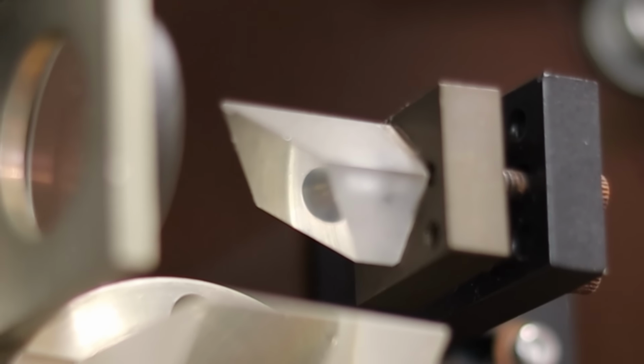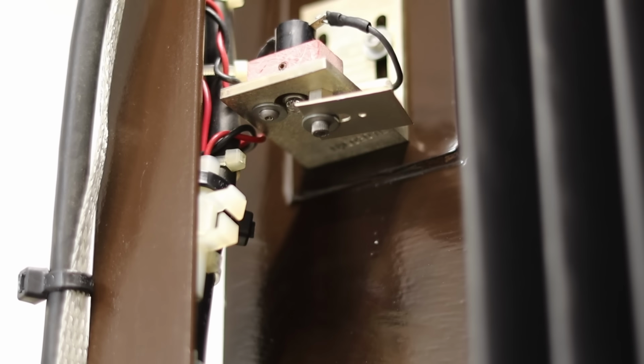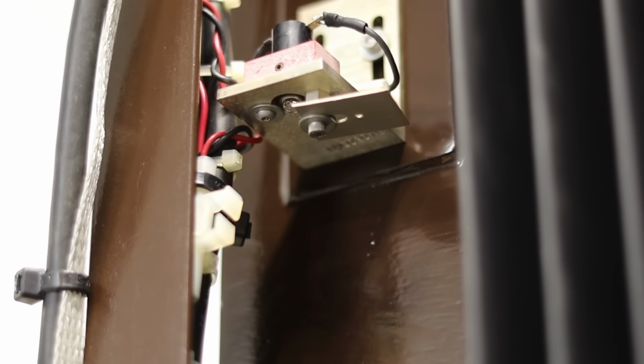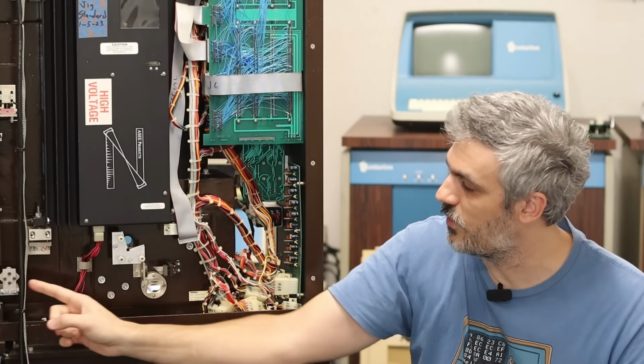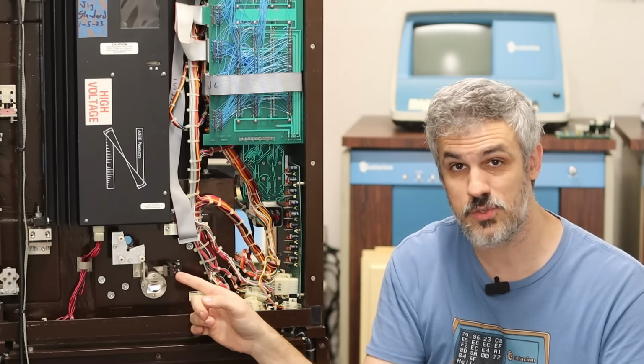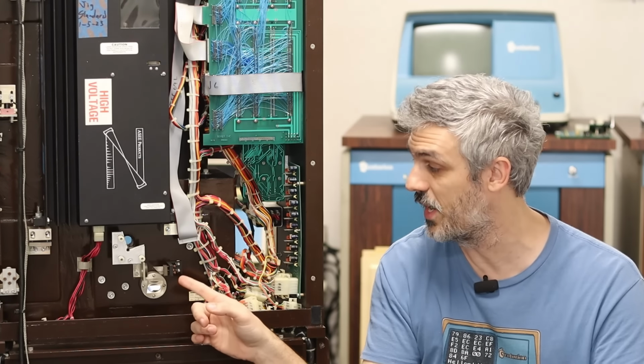But when it chops that corner of the block out, it fills in that extra corner with white light that is generated by this little lamp up here, which comes down, reflects, and then passes through a lens and joins up with that laser right here.